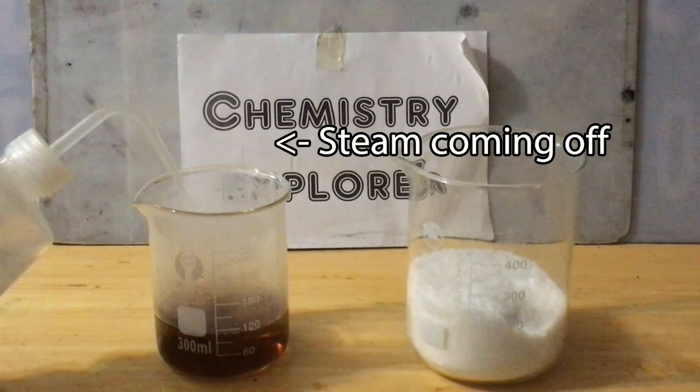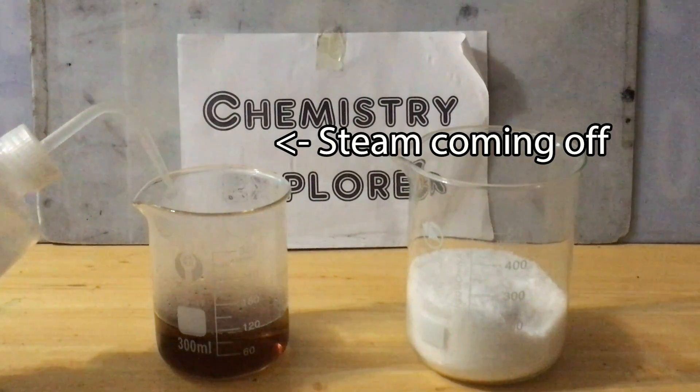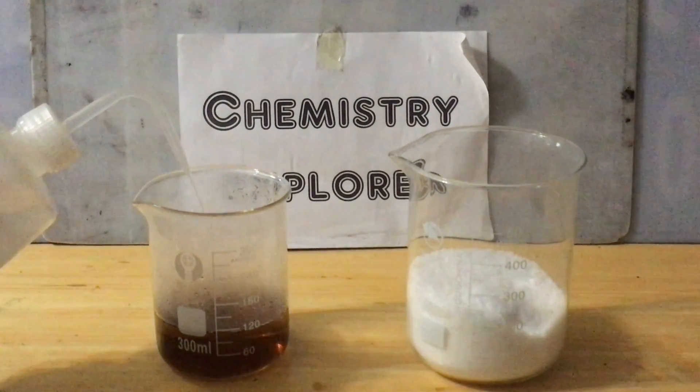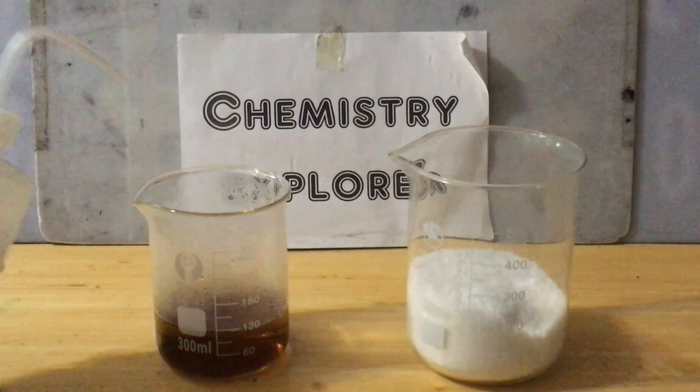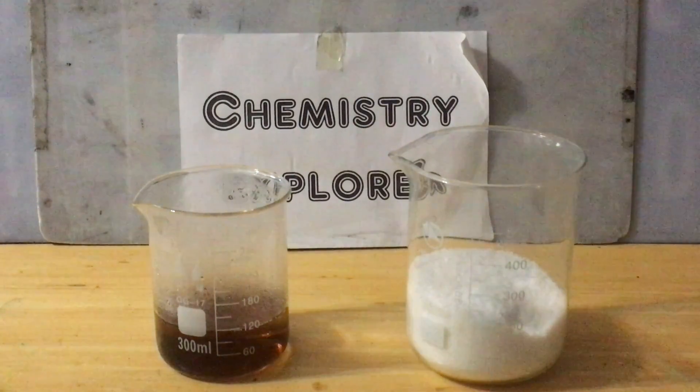After adding the acid, add the acid to a 500ml boiling flask, followed by the nitrate salts. So, let's move on to the synthesis part.